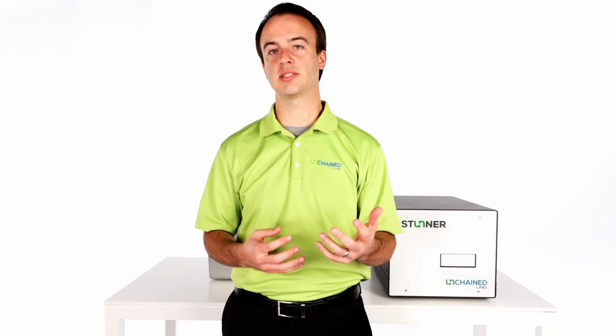Hi, I'm Kevin and I'm here to talk about Stunner's new AAV quant application. It gets you answers on full capsid titer, total capsid titer, empty-full ratio, and aggregation in only minutes with just 2 microliters of sample. Let's go take a look.